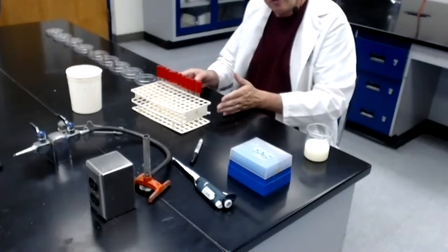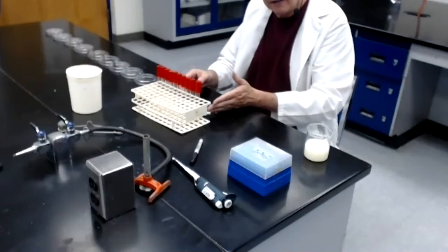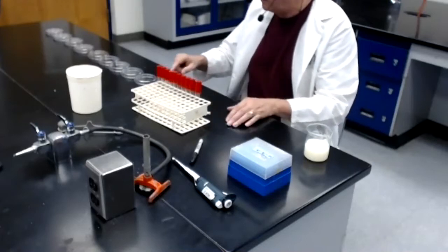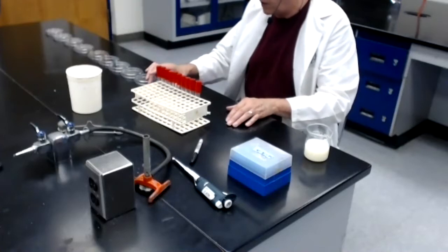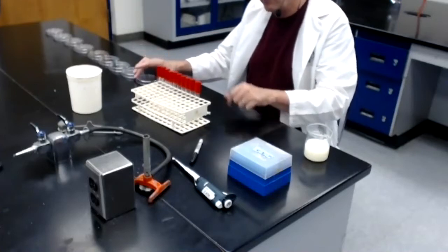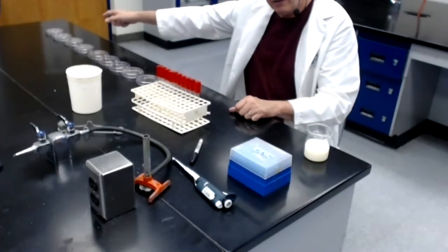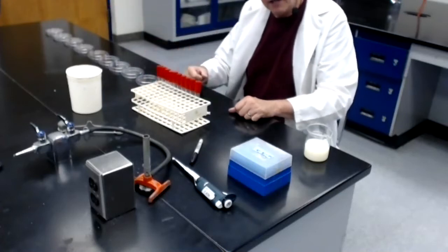So each of these tubes has been labeled with a different dilution number, going from 1/10 in tube number 1 to 1/10 billionth in tube number 10. And as I mentioned, I have labeled these 10 plates similarly. So there is a 1/10 plate for the 1/10th tube, a 100th plate labeled for the 100th tube, all the way down to the 10th plate. The 10th plate is labeled 1/10 billionth to match up with the dilution tube that is labeled 1/10 billionth.